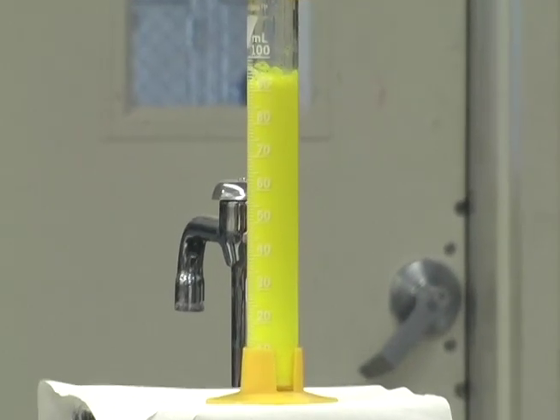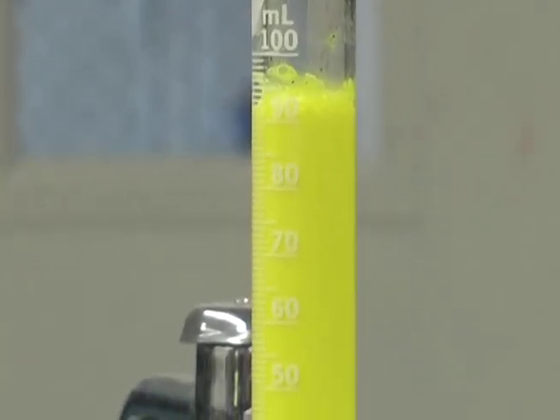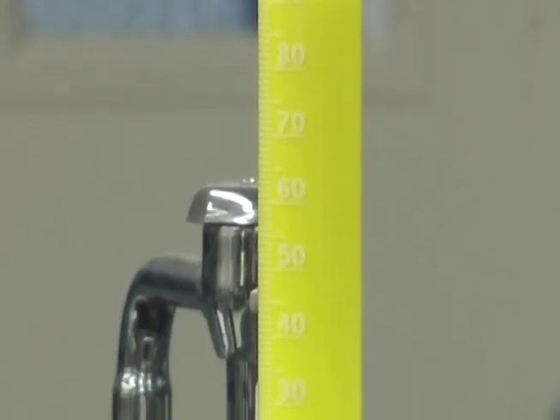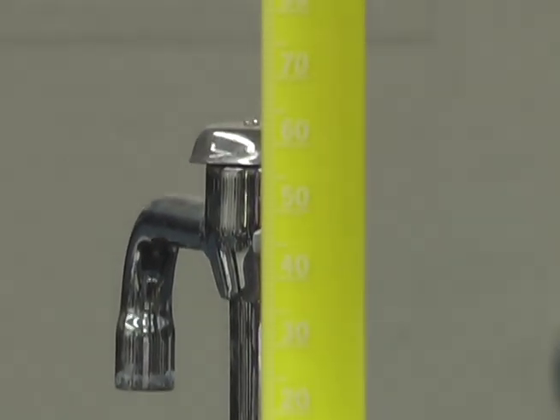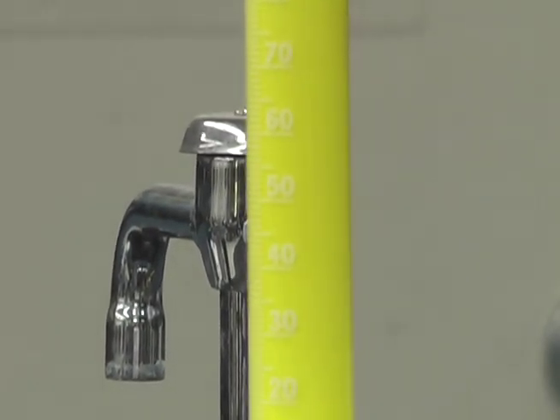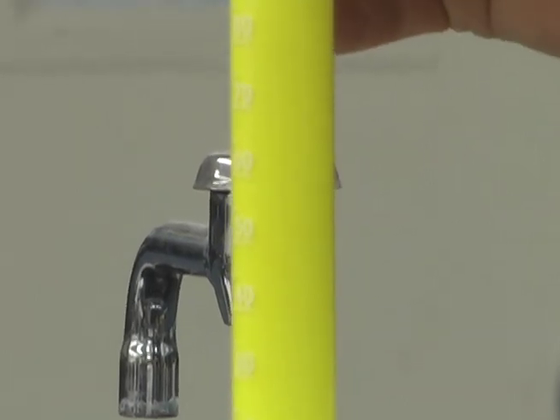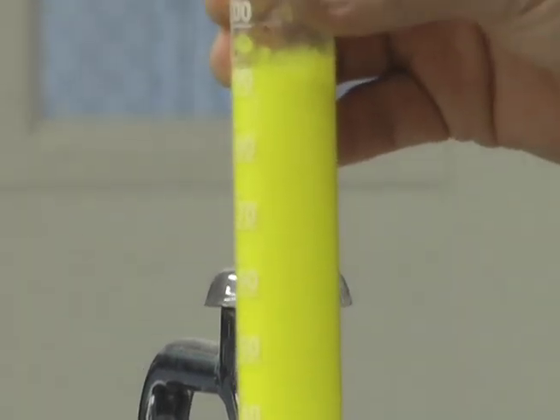So you get a nice yellow precipitate, that's a solid. That's okay. One of the products is lead two iodide, and that's what this yellow solid is, is lead two iodide.